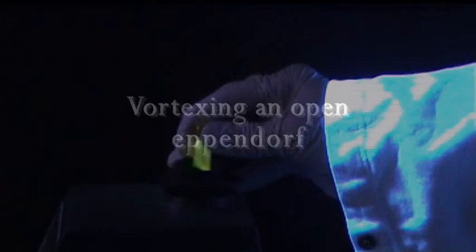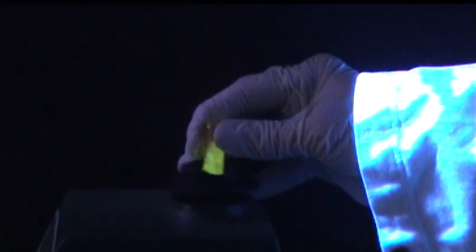We will now show how vortexing an open Eppendorf tube generates an aerosol, leading to the spread of contamination. As you can see, during the vortexing, a considerable amount of fluorescein ends up on the glove. The contamination can be easily transferred to any object touched by this contaminated gloved hand.